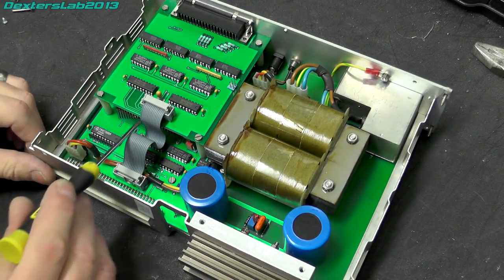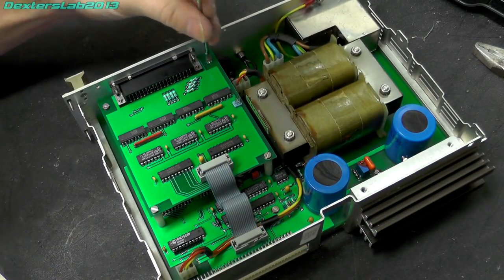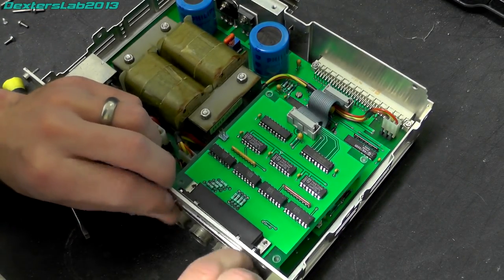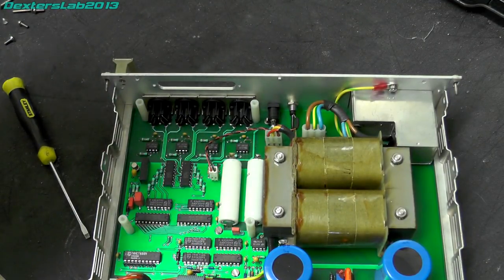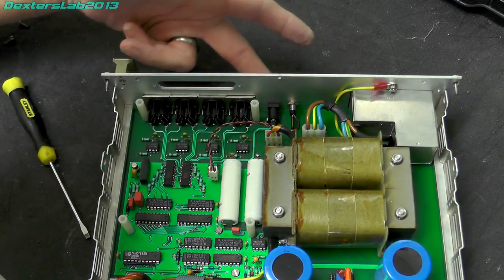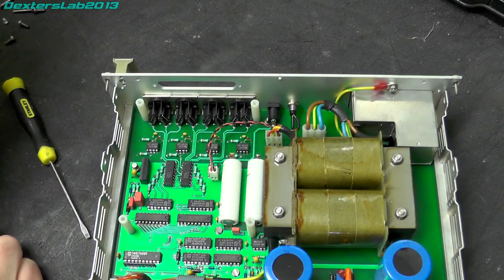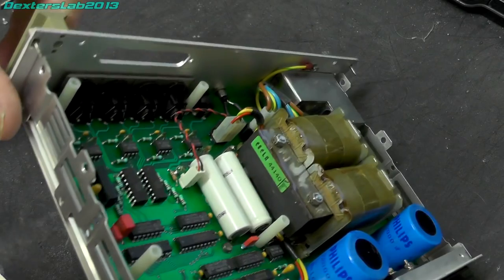So there's a few bits going on underneath here, so I'm just going to take off this board here. Yeah, not a huge amount really. We've got more opto isolators out to those DIN sockets, so not a huge amount going on there. We've got the power light, the jack port for the accessory, and a couple of, are they rechargeable batteries? I'm going to hazard a guess that they are rechargeable batteries.